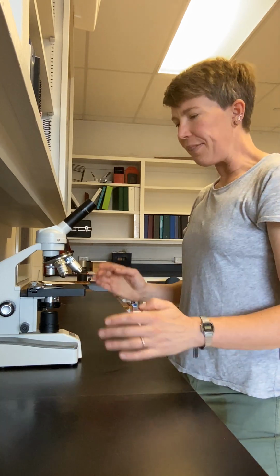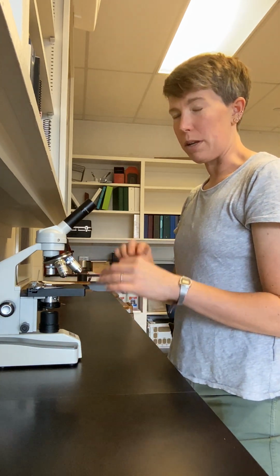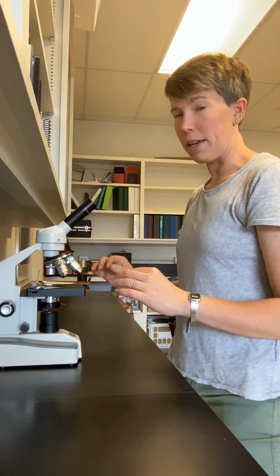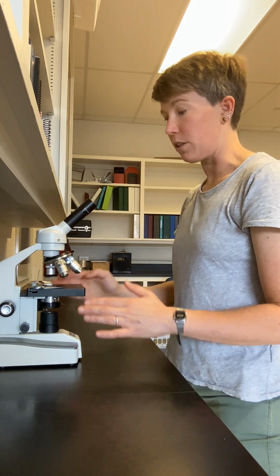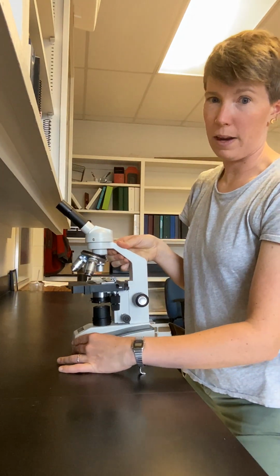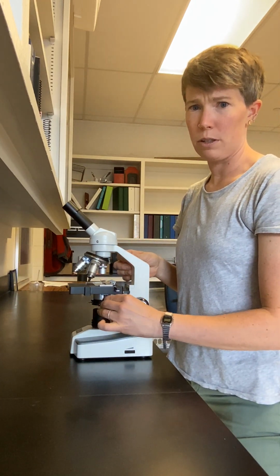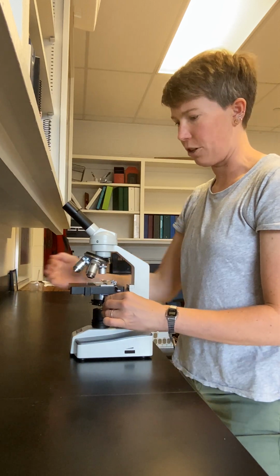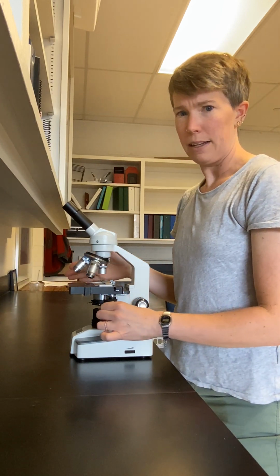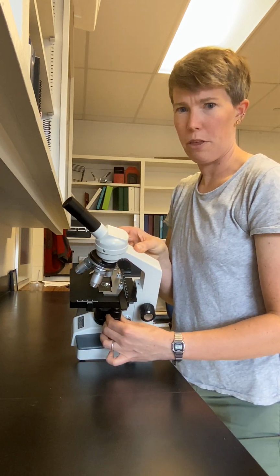At this point, when the slide is on the stage, you're no longer going to manipulate or touch the slide directly. Any changes that you make to the position of the slide on the stage are done through the orientation knobs. There are 2 knobs that are directly underneath the microscope right here, the orientation knobs. One is a north-south orientation. This moves the stage up and down this direction, and the other is an east-west orientation. You can't see it as well in this, east-west moves the slide back and forth here.